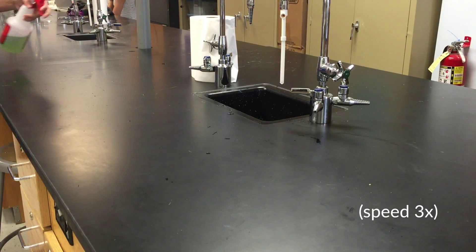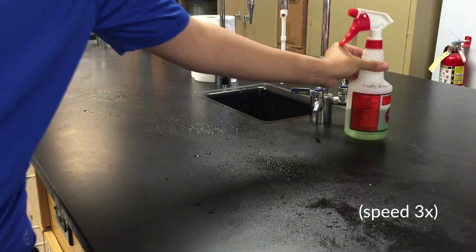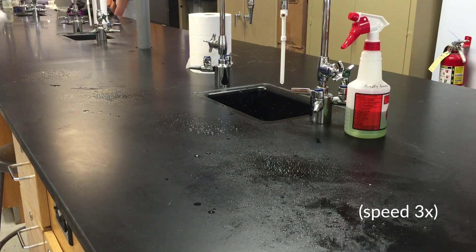For cleaning a lab bench, use Simple Green. Just spray down the area and wipe it down with paper towels.